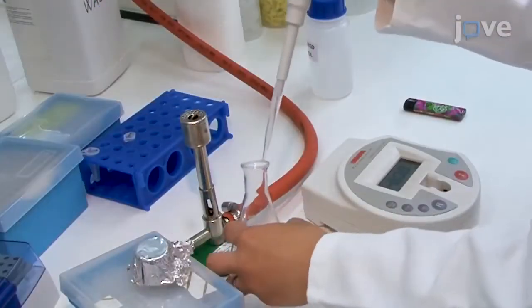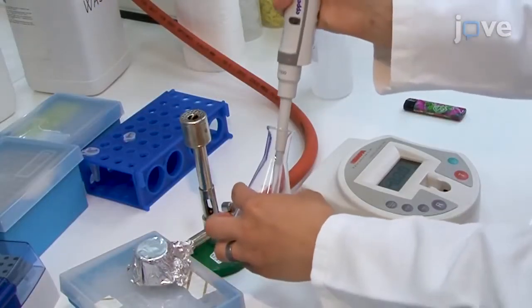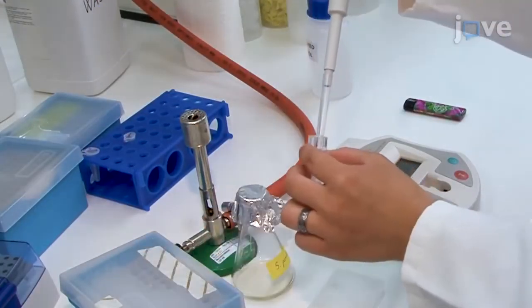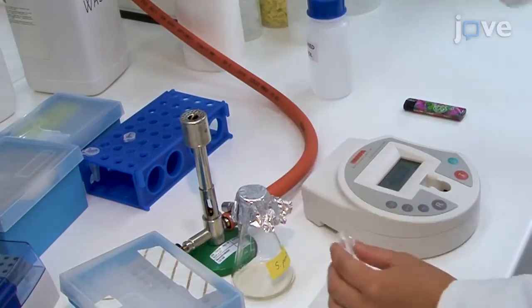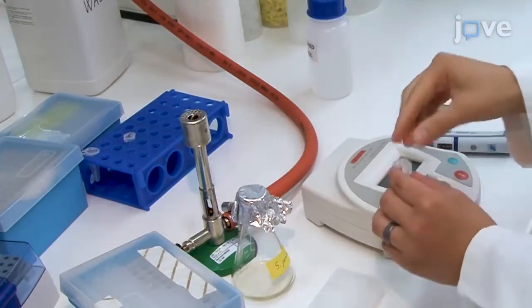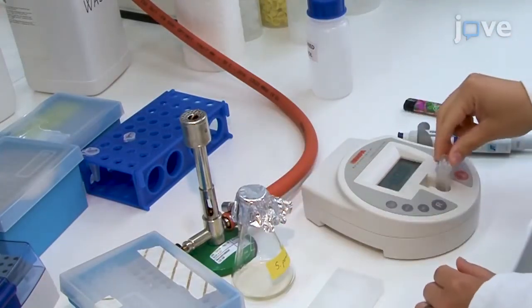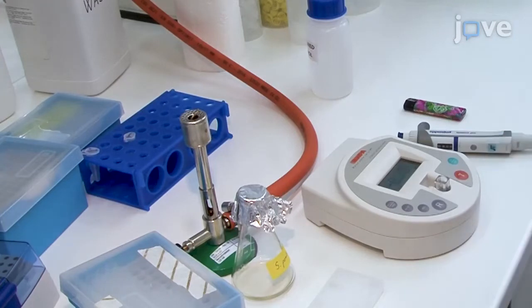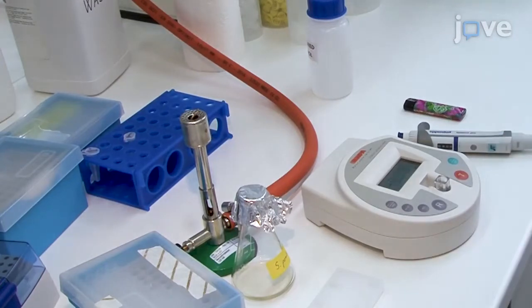Next, measure the optical densities of the cell cultures, and for cultures to be analyzed in the same growth phase, try to reach similar values among all tested cultures to ensure comparable experimental conditions.